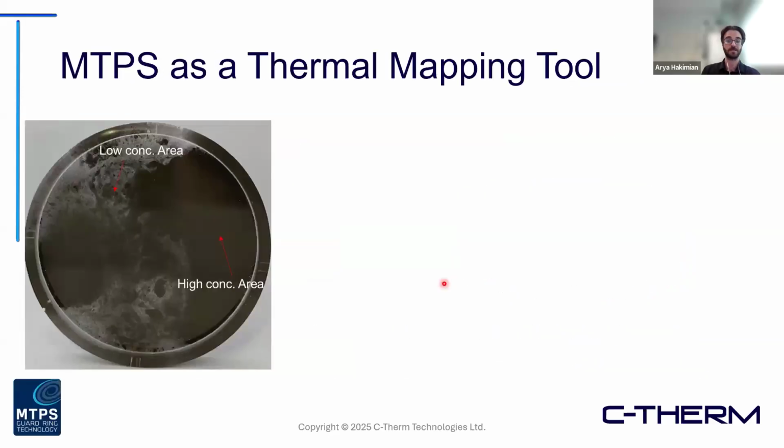So with the MTPS, there's what we call thermal mapping. In this example that I'm showing here, this was an epoxy resin with a conductive metal nanoparticle dispersed throughout. As we can tell just by looking at it, not a great sample. There's clearly areas where there's higher and lower concentrations, non-uniform, not the best.